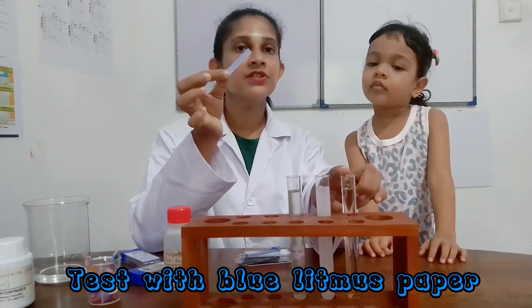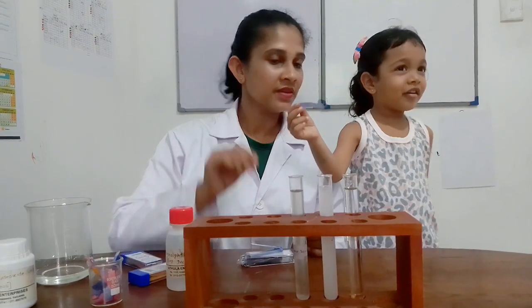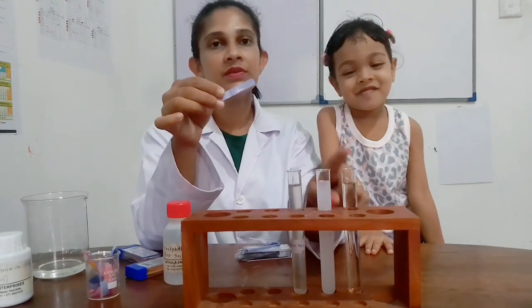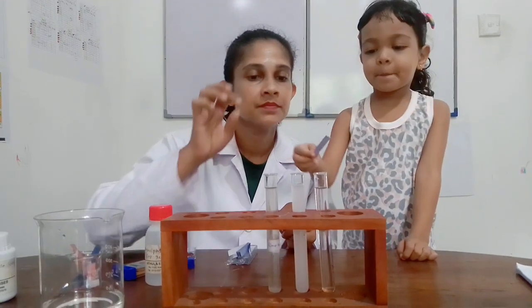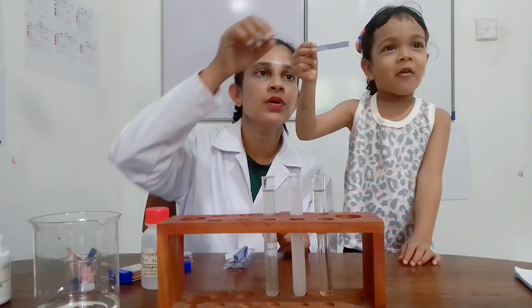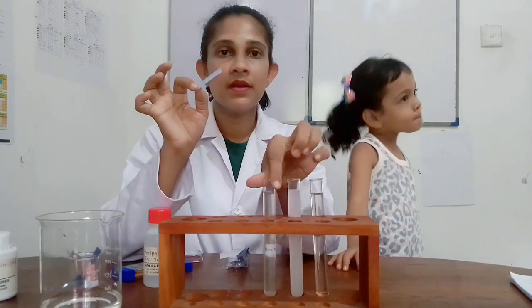Now I'm going to try blue litmus paper with Jeevani solution. Color change or no? No, only blue. With Jeevani solution, blue litmus paper does not change its color. Soap solution with blue litmus paper. Color change or not? No. No color change with blue litmus paper in soap solution. Only blue. Now blue litmus paper with lime juice.